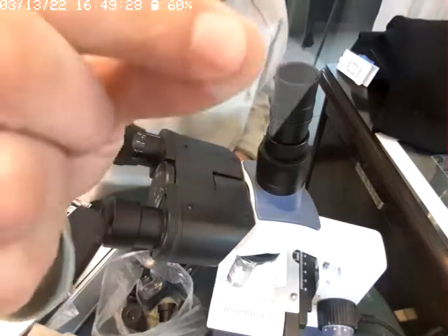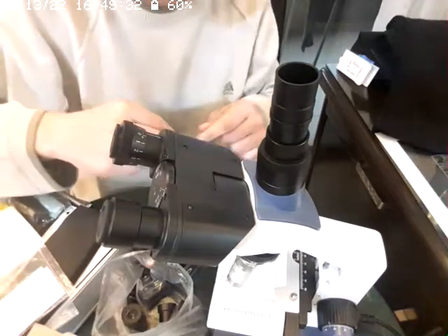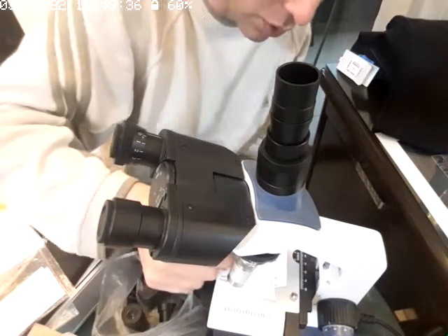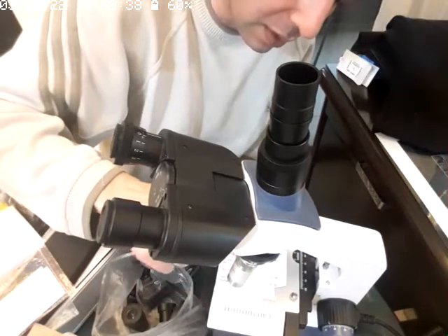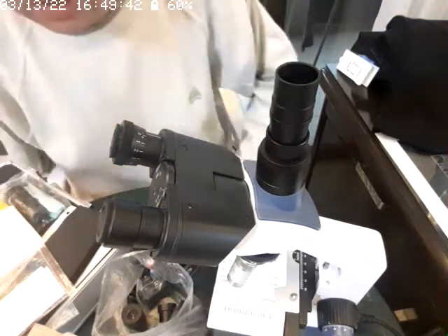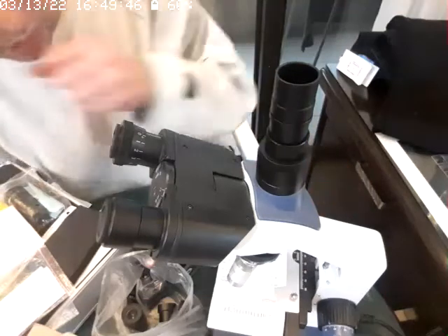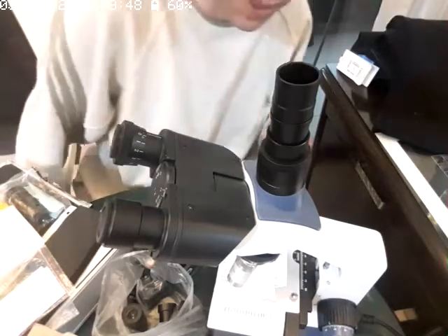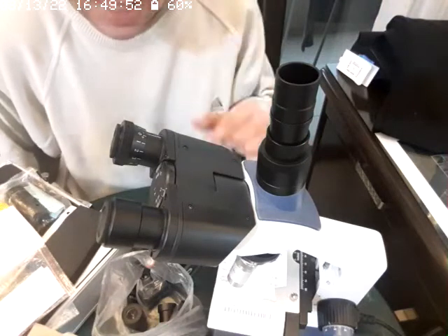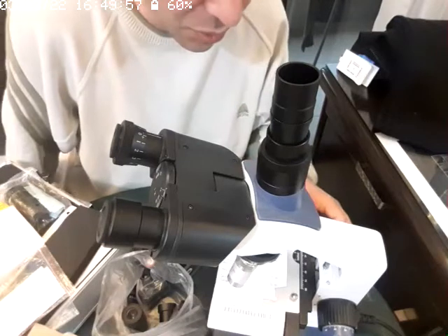This is usually used to cover your object that's sitting on the slide, but I don't have anything, and I don't want to lose it. It's a very thin filament, or if you want to say, a thin membrane of glass. Okay, it's not a membrane, it's thicker than a membrane, just for saying, you know what I mean. I just don't want to use it anyway.